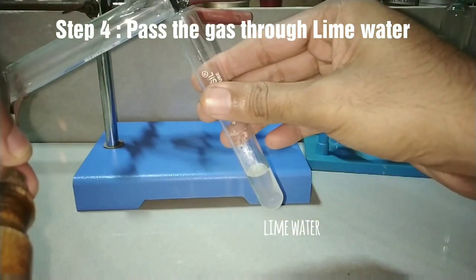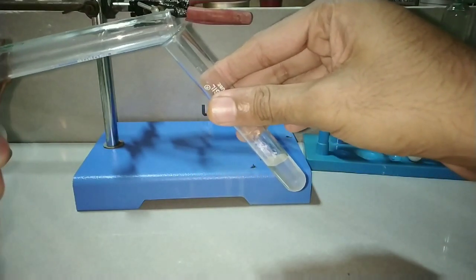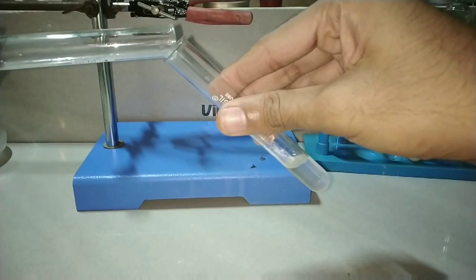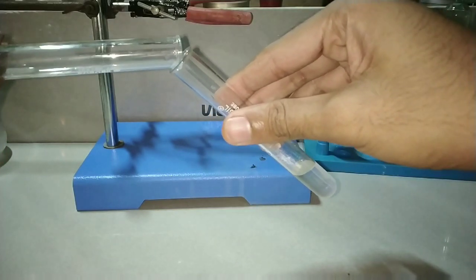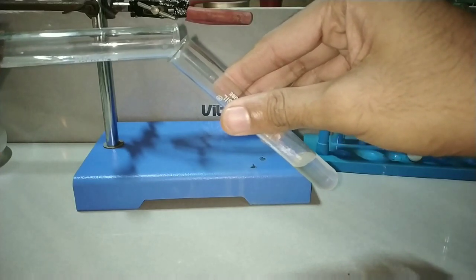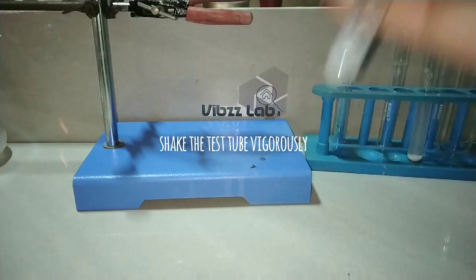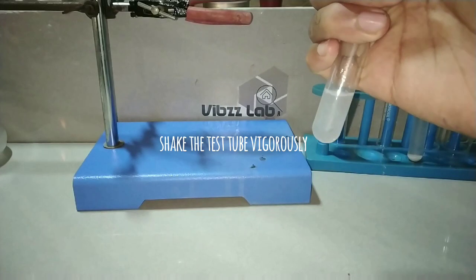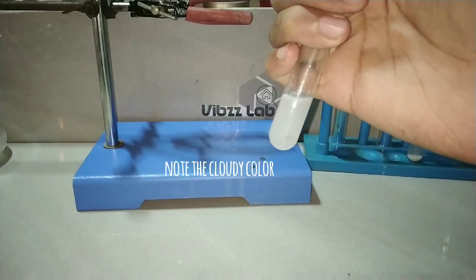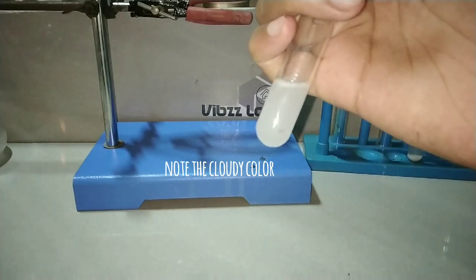Now we pass the gas through lime water. Lime water is calcium hydroxide solution, prepared by mixing solid calcium hydroxide in water and filtering out the solid contents. After passing the gas, shake the test tube vigorously. You can observe that the lime water has turned milky.